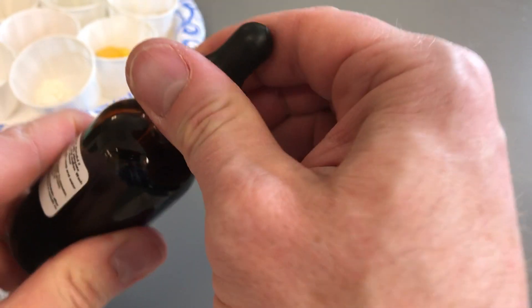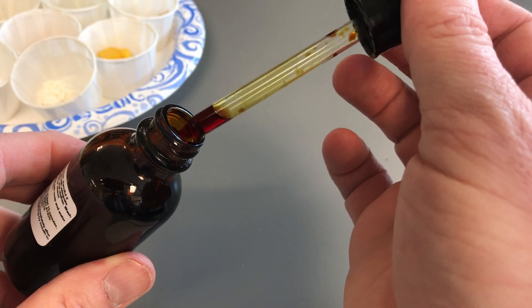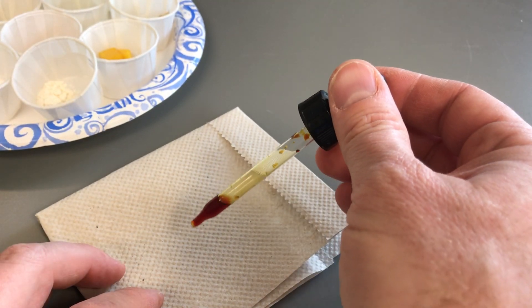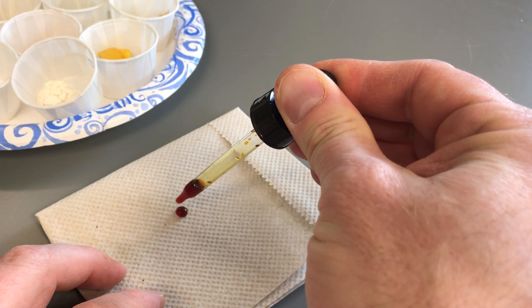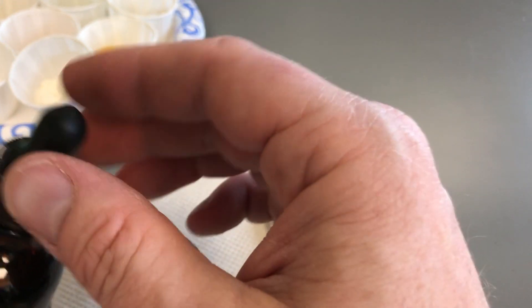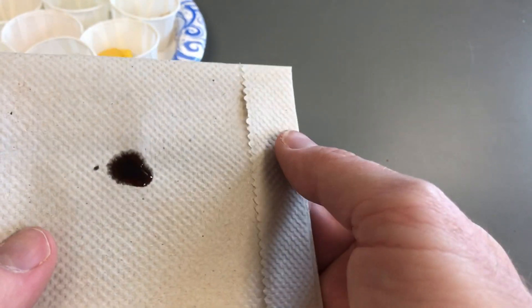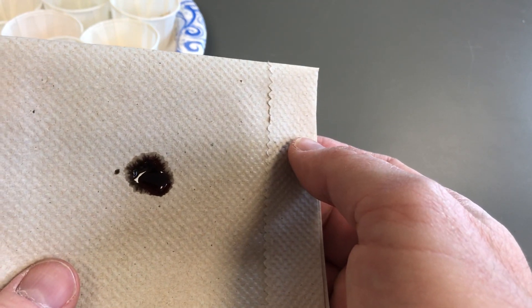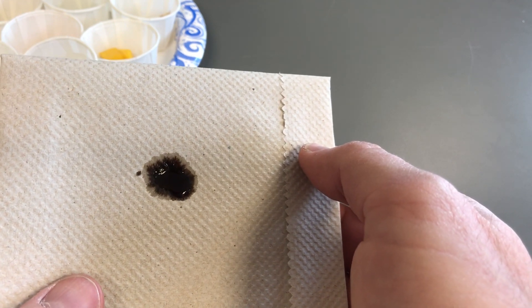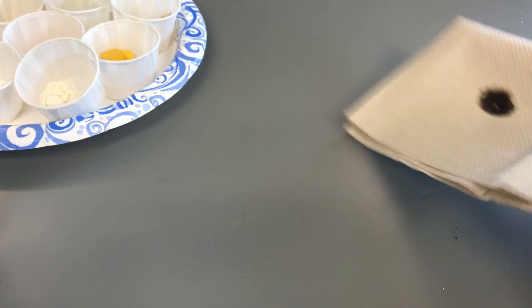Iodine by itself has what's known as an amber color — that yellow reddish-brown you see. A positive test for starch is a black or very dark color. If we put iodine on a paper towel, the paper turns dark black — that's what we're looking for. If the food turns dark, that's a positive result for starch. If it stays yellow reddish-brown, that indicates starch is not present.